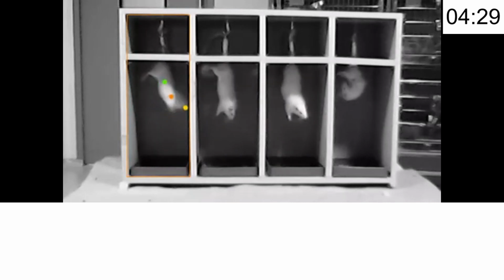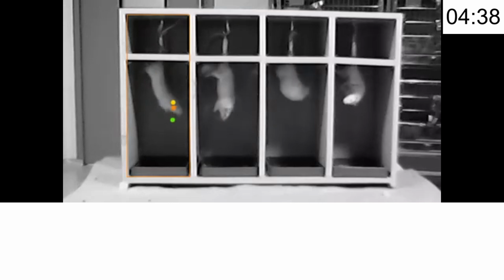Multiple-compartment enclosures allow testing of multiple animals at once, which increases efficiency. While you conduct the experiments one by one for each animal, it takes a long time and you get bored also. So you need to develop or fabricate that kind of instrument. It should have at least 3 to 4 compartments.